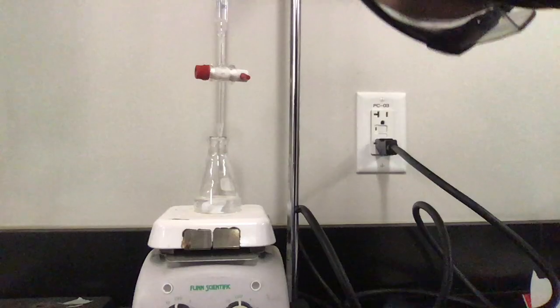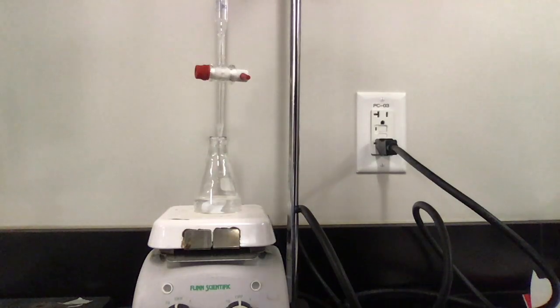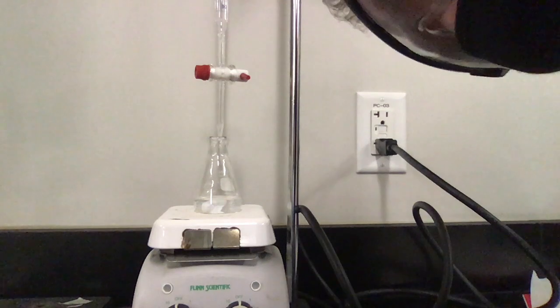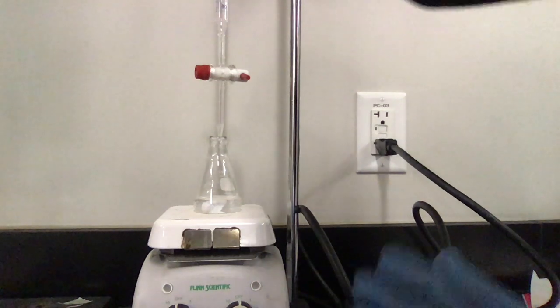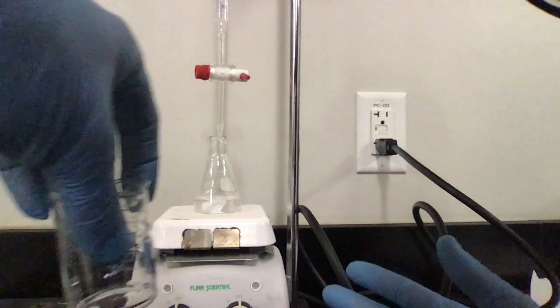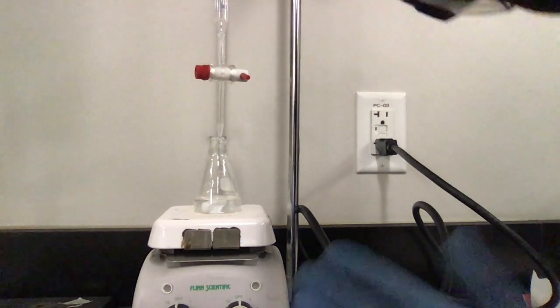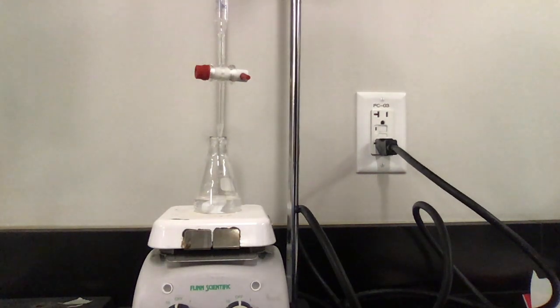I'm going to turn this camera back around. So I of course went over my zero mark when I refilled my burette, that's okay. I used this little beaker and I just emptied it out until I reached my zero mark. And now I'm at zero again on my beaker. You don't have to be at zero, right? I only need enough liquid in my burette to make my measurement. I know I'm going to do two more though. So I know I'm going to need it. So I filled it all the way back up to zero so that we can get another good data set for number two. And then hopefully from there, we'll be able to do some computations.